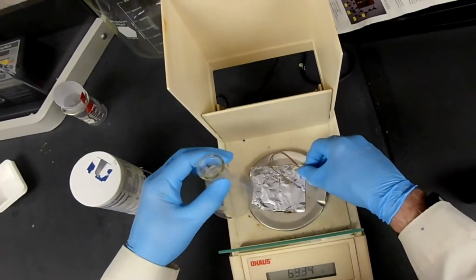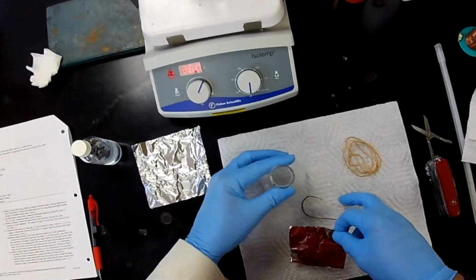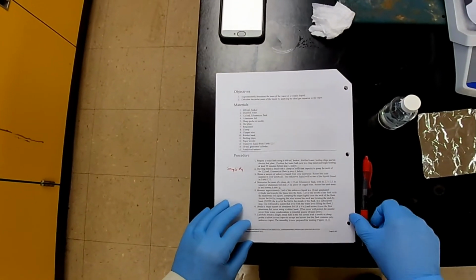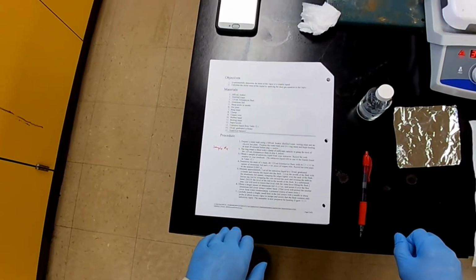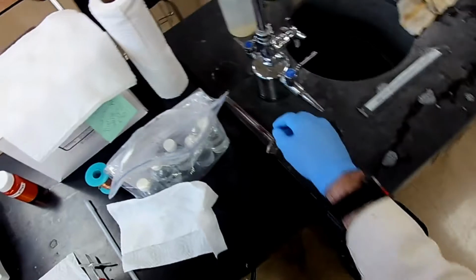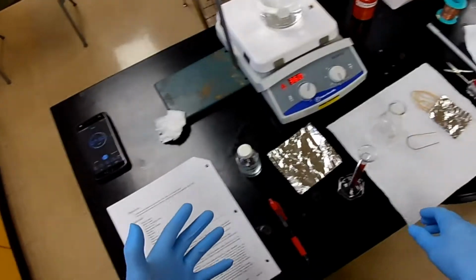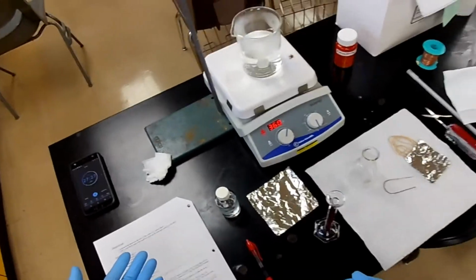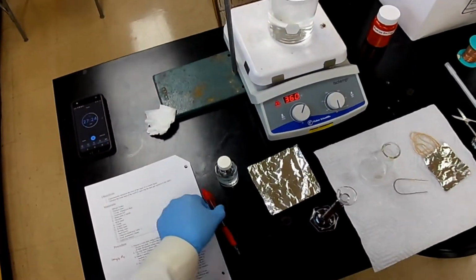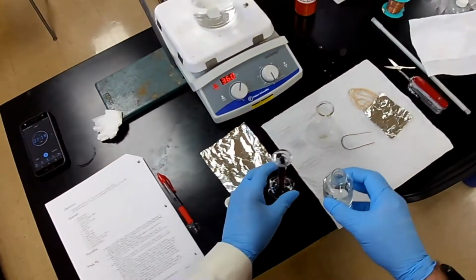All right, so let's do this, there. Now, next thing we need is to measure about 3 milliliters of the liquid. Now this doesn't have to be exact, right? We just need enough so that when it volatilizes, it will fill the space with gas, and any excess will come out through the little pinhole that we're going to prick in it. So let's give it 3 milliliters.